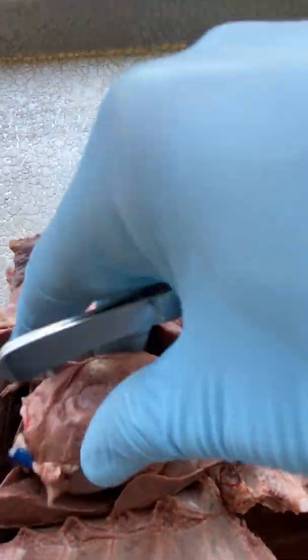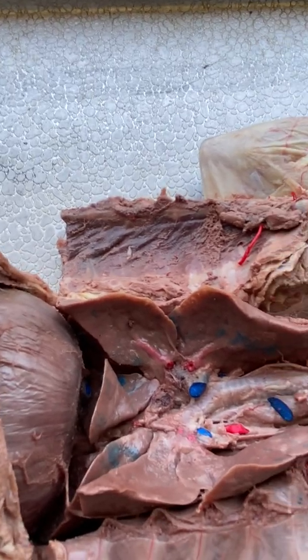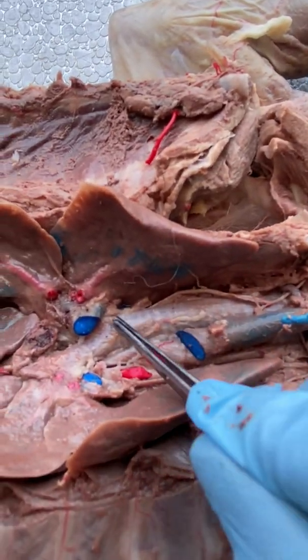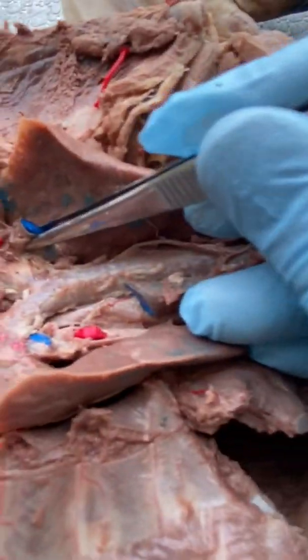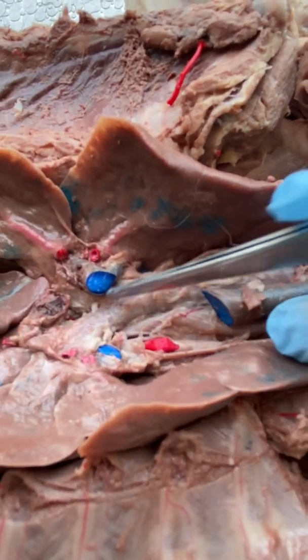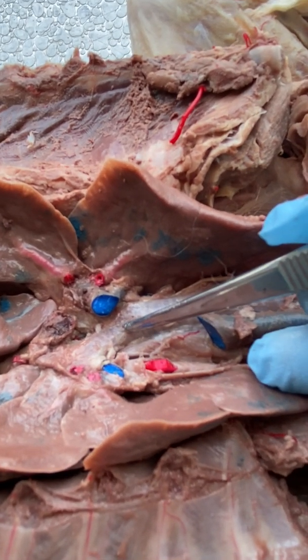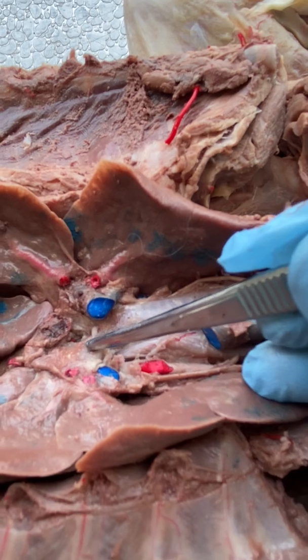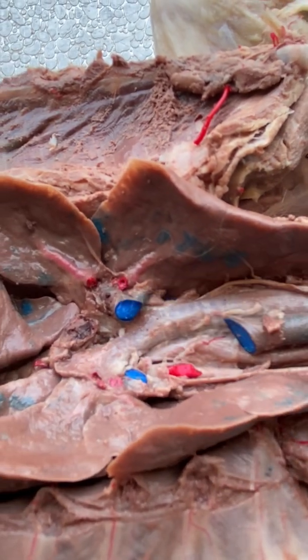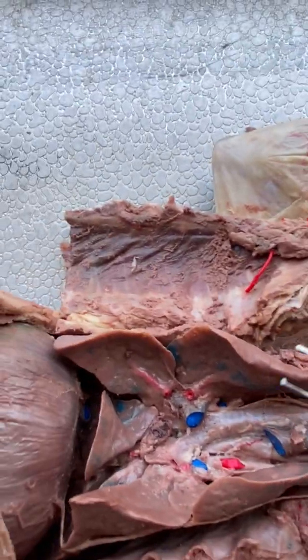The heart has been removed — it would normally sit right here on the cat. What we'll notice is that our trachea continues down the body, and right about here you can see it junctions into two sides — one side going this way and one side going the other way. Those are our primary bronchi, which then break off into secondary and tertiary bronchi that enter our lungs.